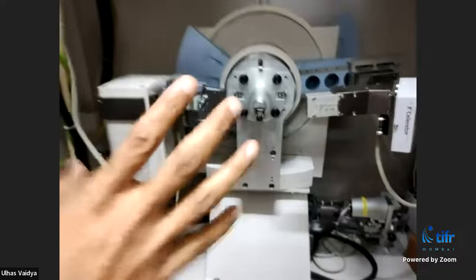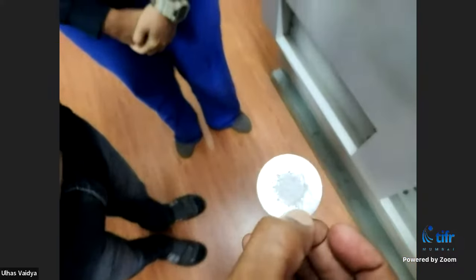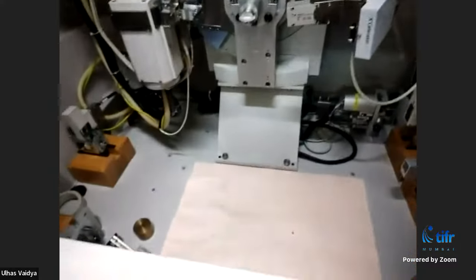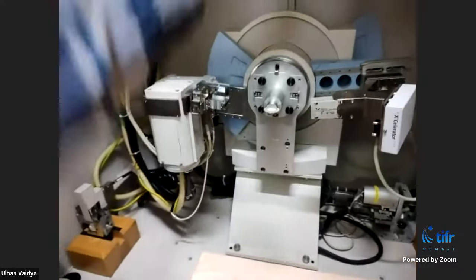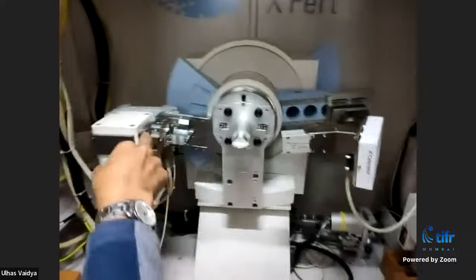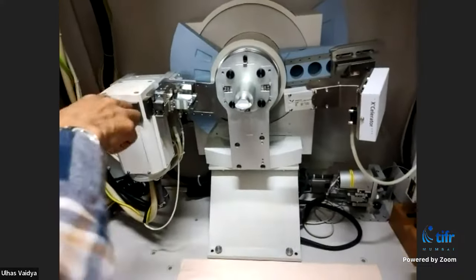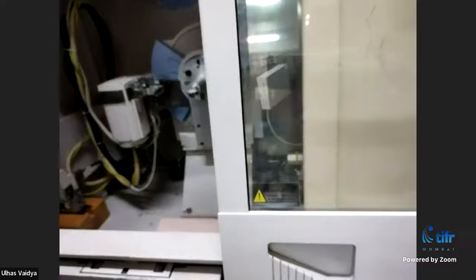We will show this with one example. First we take an amorphous sample — crushed glass powder — and see if any peaks come from this. Then we compare with a crystalline sample. When we start the X-ray diffractometer, the X-ray tube moves upward in the theta direction and the detector moves upward, making 2-theta. Both can go up to less than 90 degrees. When they go up, they come closer.